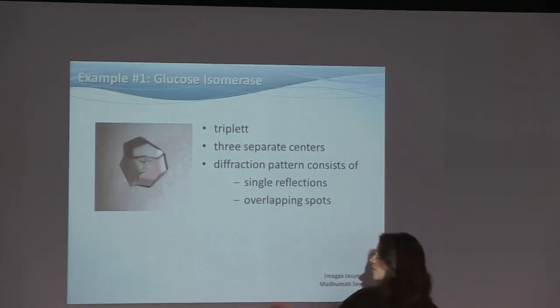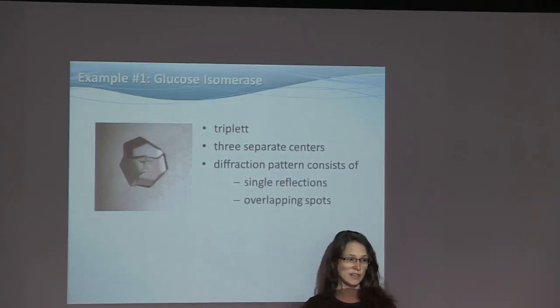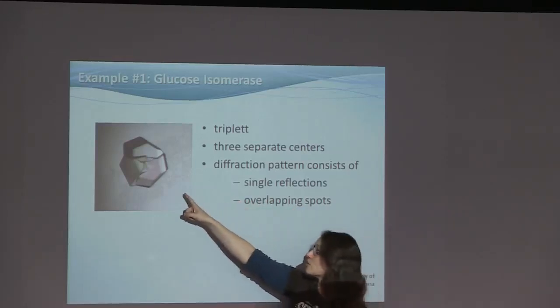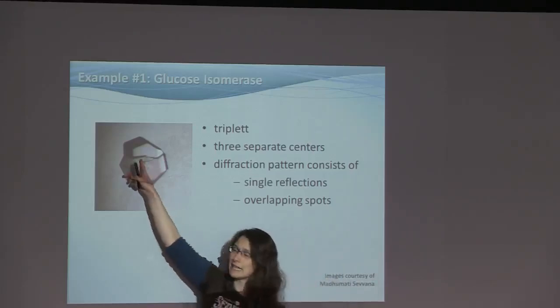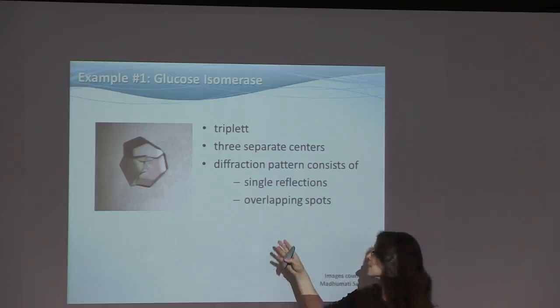Here is a crystal from Madhumati Sevana's PhD thesis. Madhumati did her PhD thesis on non-merohedral twins in macromolecules, which was kind of pioneering work for this, really. This crystal is a triplet. As you can see, it has 3 separate centers. So we would have a difficult time centering this crystal, right? We could center it on the middle, accepting that we are not centering any of the domains correctly, or we can center on one of them and just try to get, so it's really difficult.